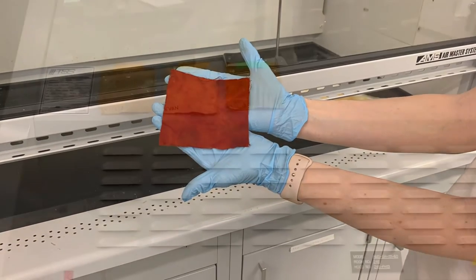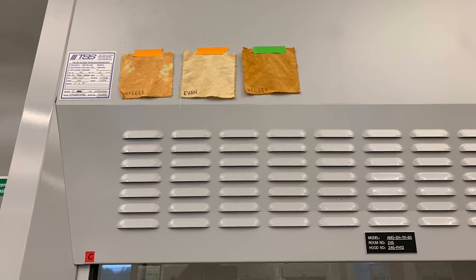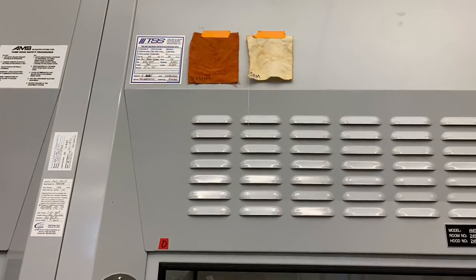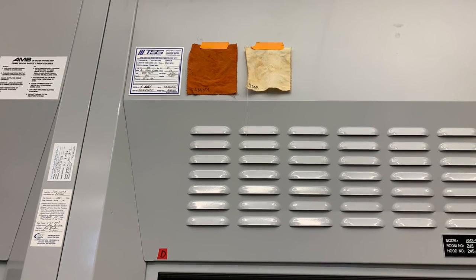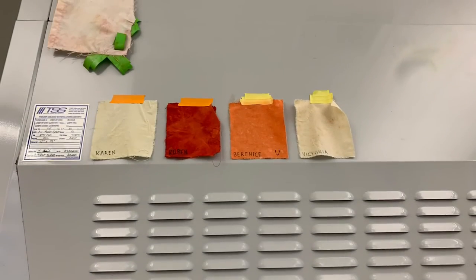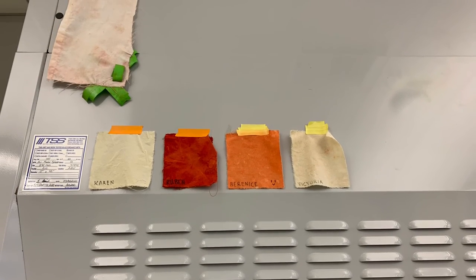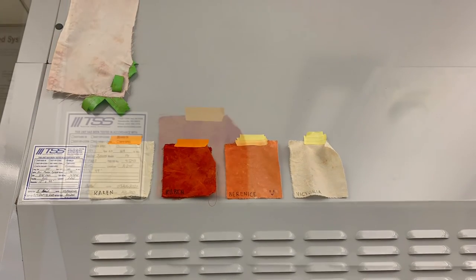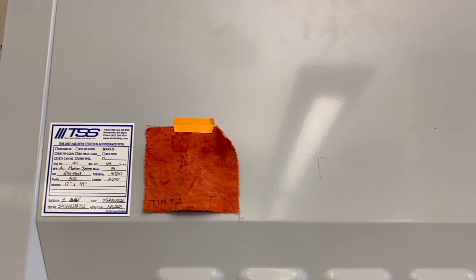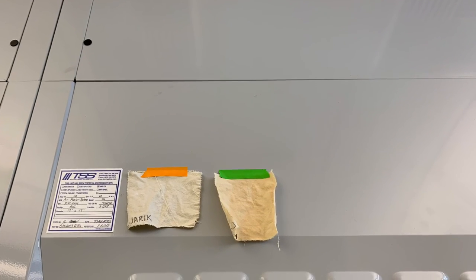Here's a picture of my cloth and as you can see my dye turned out to be a really deep red color. Here are some pictures of cloths dyed by students who have taken this class in previous years. The color of the dye synthesized in this experiment depends on which compound you choose as your diazo component and which compound you choose as your coupling component — so there are a lot of different options. One of the fun things about this experiment is just getting to see what color your dye turns out to be.